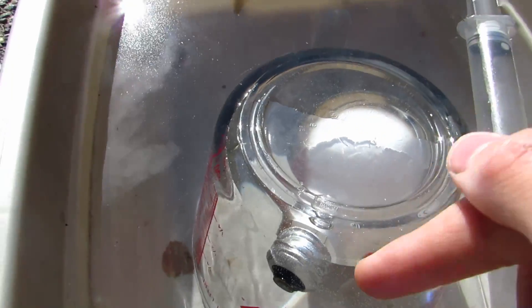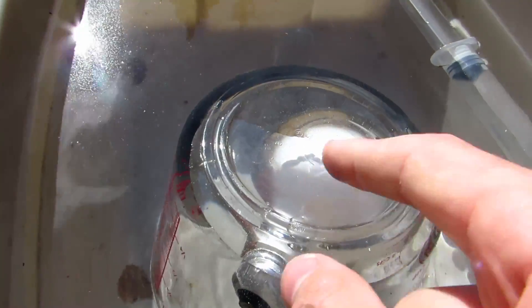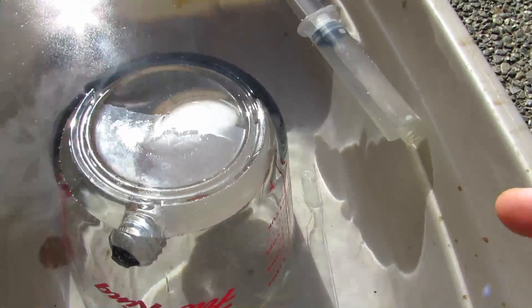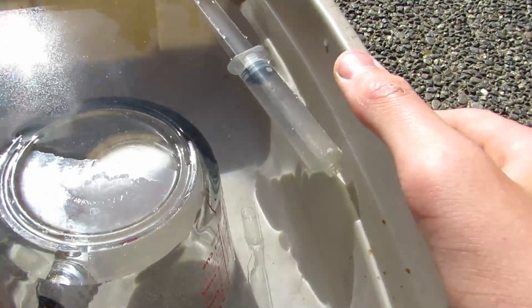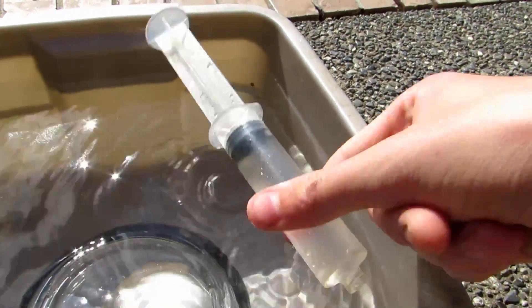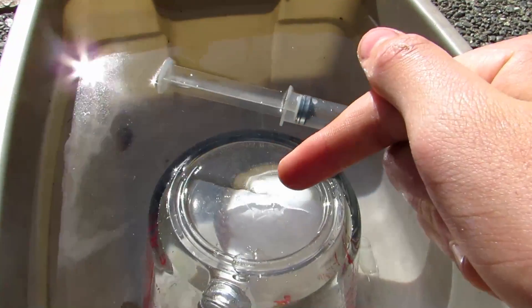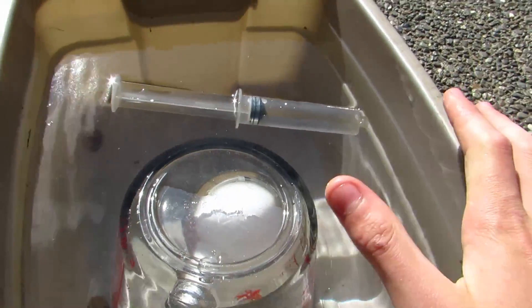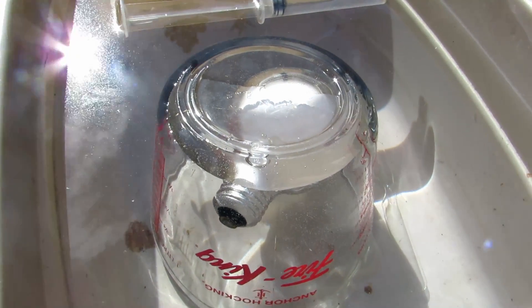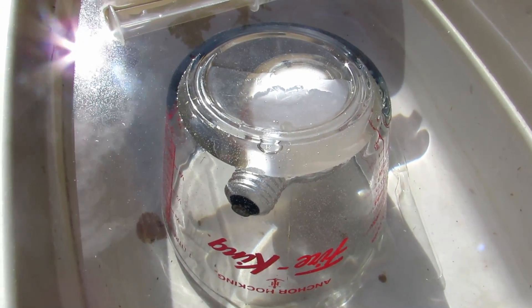You're going to have to make sure there's no air inside of this measuring cup and that it's upside down. Any glass container will work for this, but there can't be any air because you don't want the argon to be contaminated. Our huge tub is going to have to be fairly deep so we'll be able to stick the syringe in, which is also going to be full of water. There's no air in this syringe, so we can stick the syringe in, squish out the water, and then suck up the argon and stick it into the test tube.